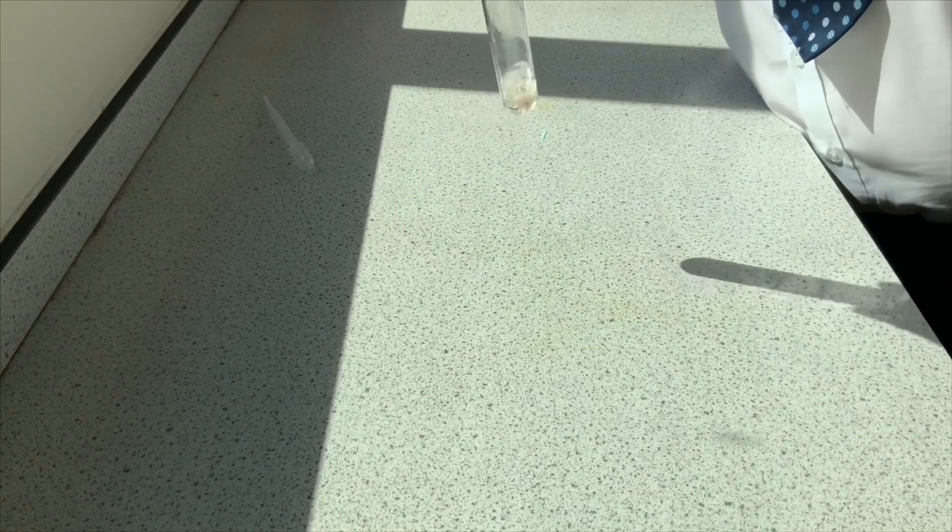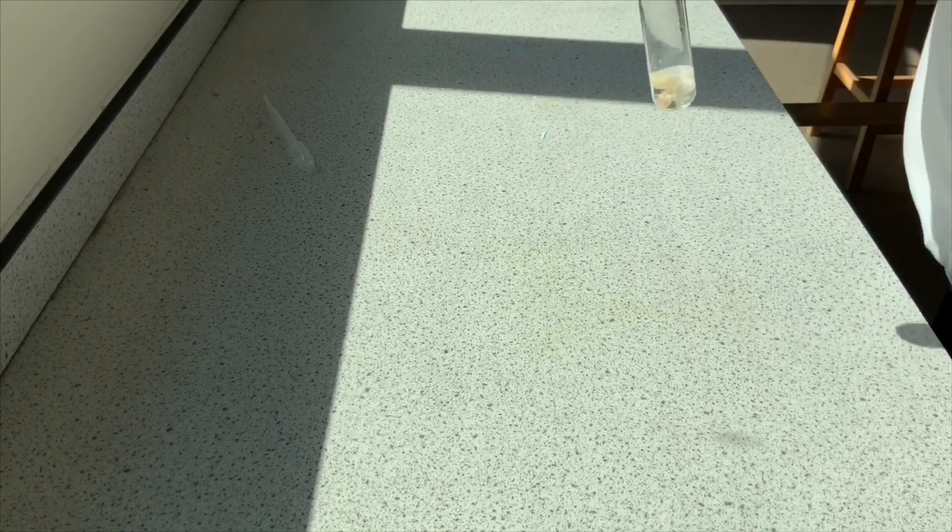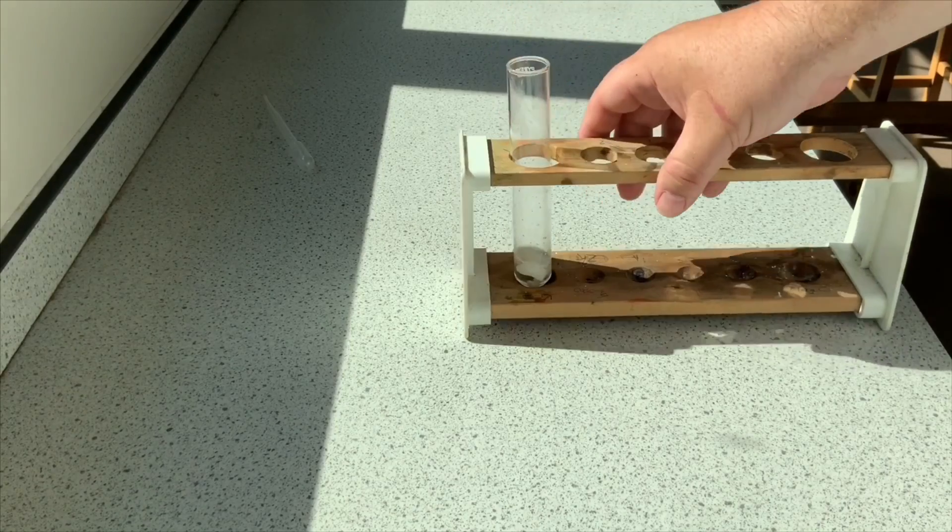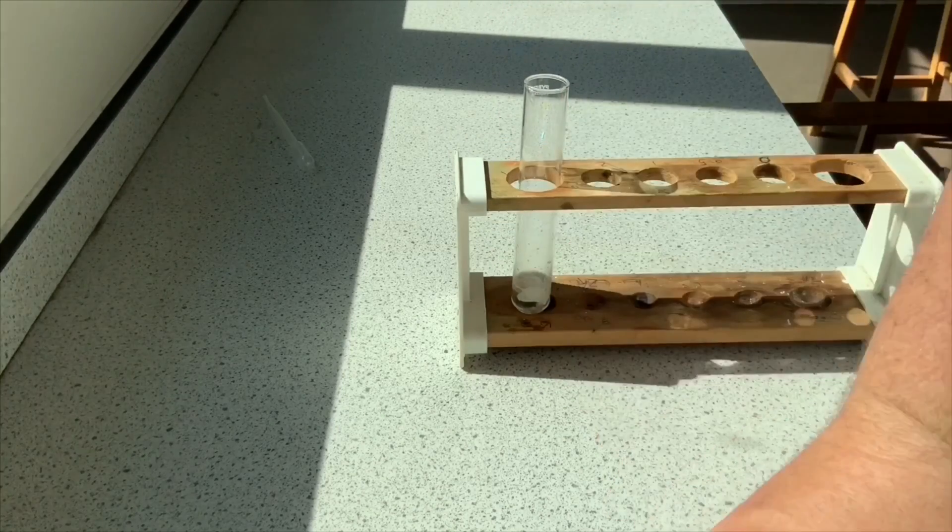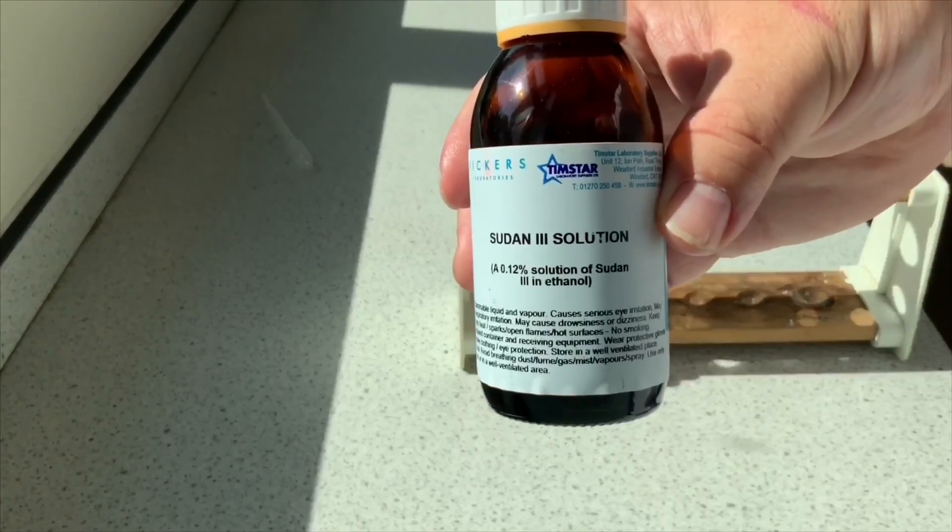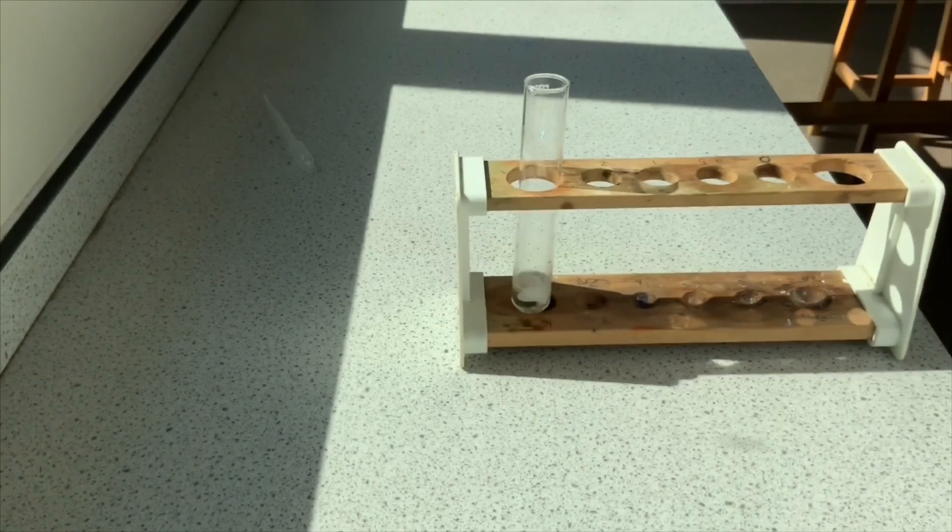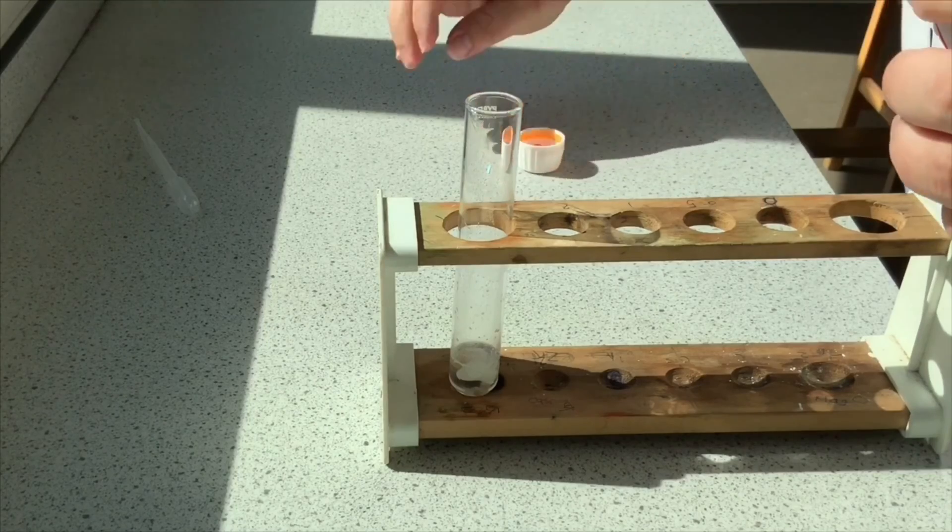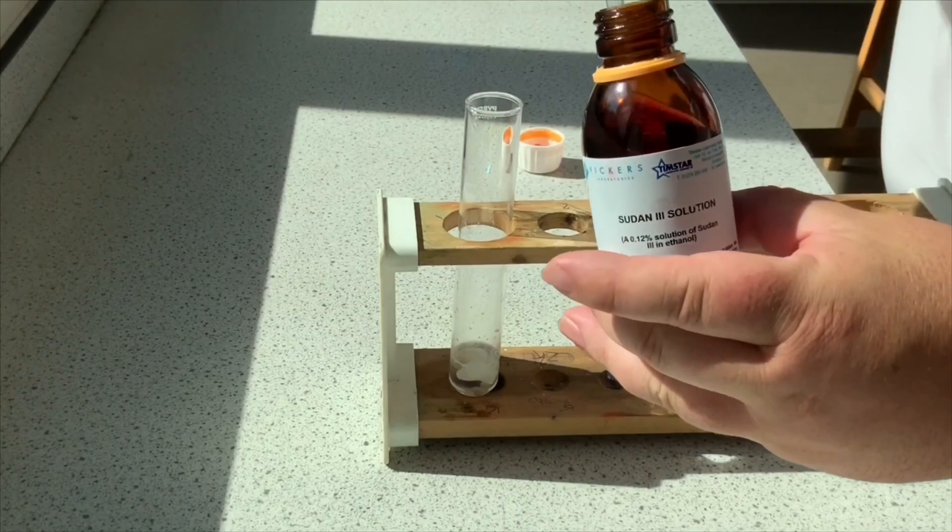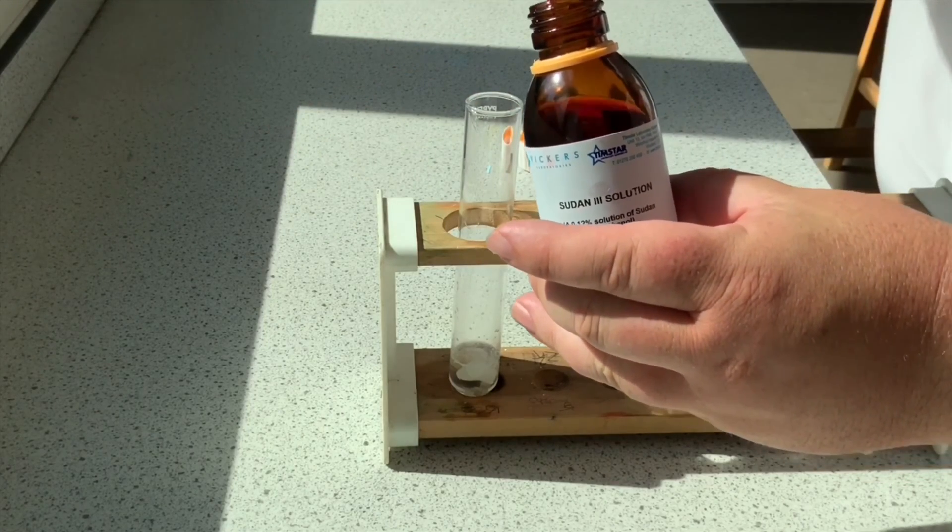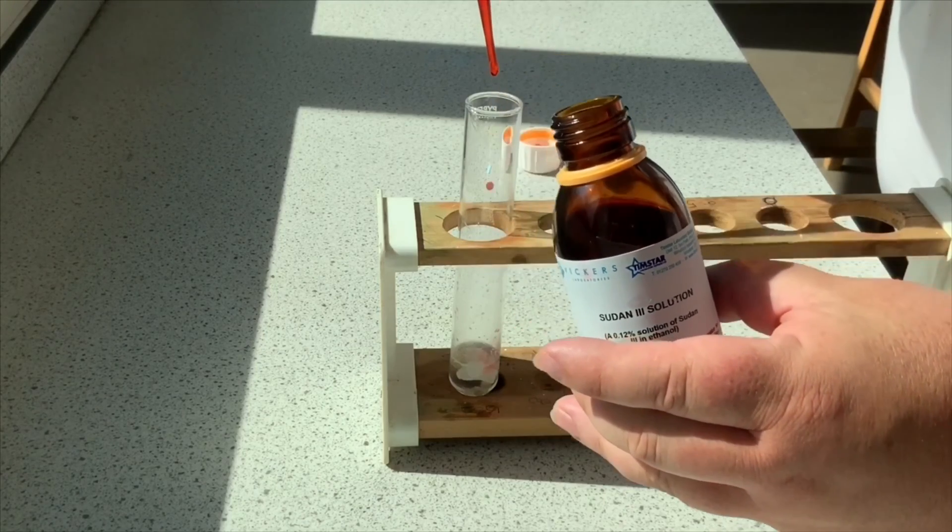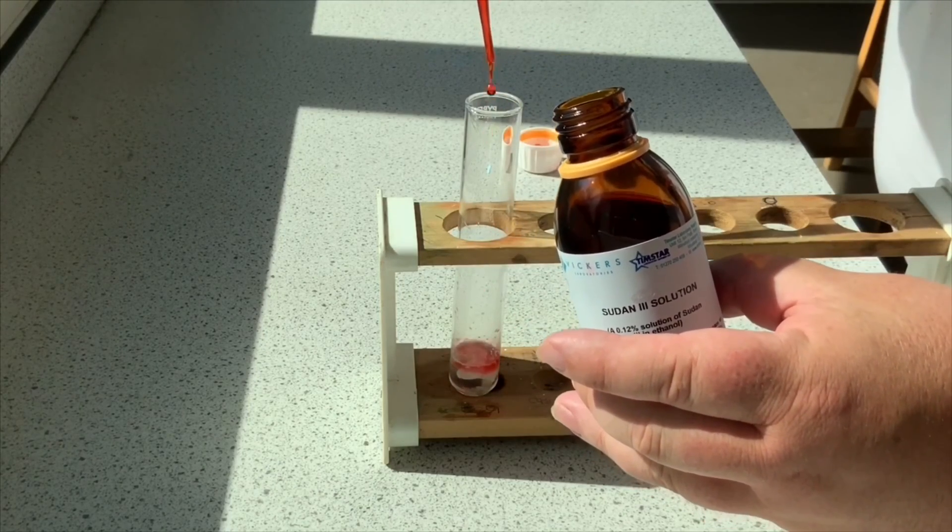Give it a gentle shake. So in goes the fat over here. Give it a gentle shake with the water, and then I put in a few drops of my Sudan III. What I should notice is as I stick it in, the whole solution starts to go reddish in color, but the lipids on the top actually get attached to the Sudan III.